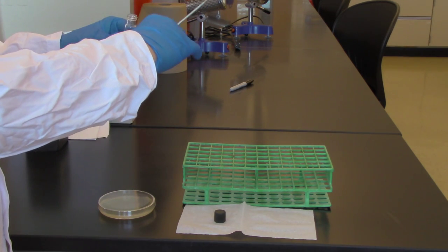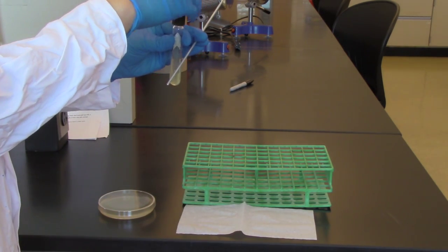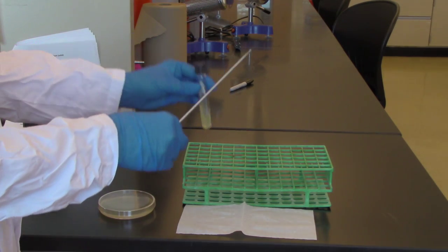When I'm finished, I'm going to hold onto that tool, get the lid, replace it onto my slant, and return it to the rack.